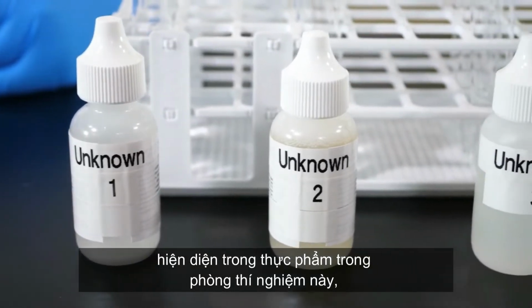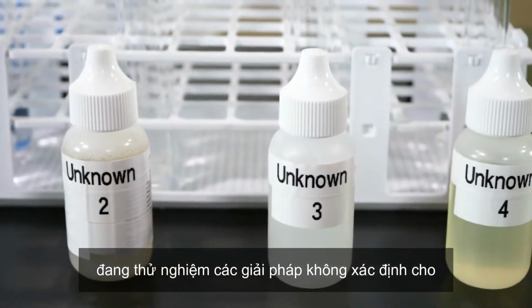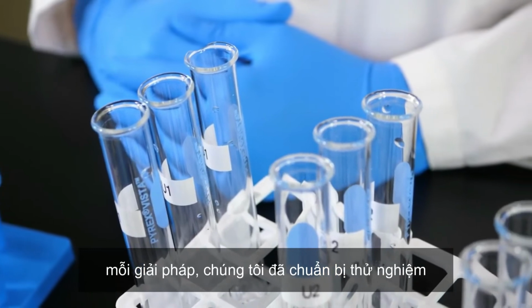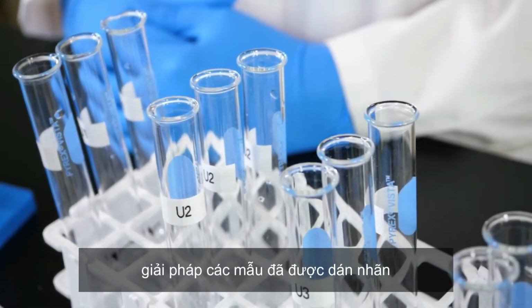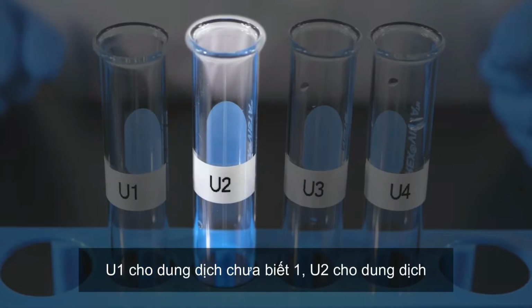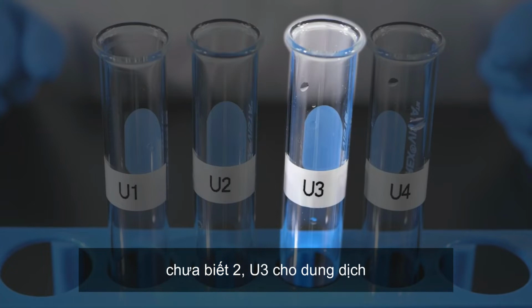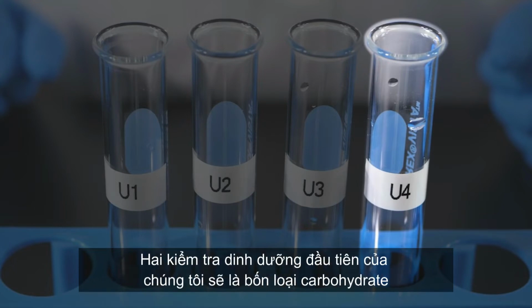During this lab, we will be testing 4 unknown solutions to determine what nutrients are present in each solution. We have prepared test tubes with samples of the 4 unknown solutions. The samples have been labeled U1 for unknown solution 1, U2 for unknown solution 2, U3 for unknown solution 3, and U4 for unknown solution 4.